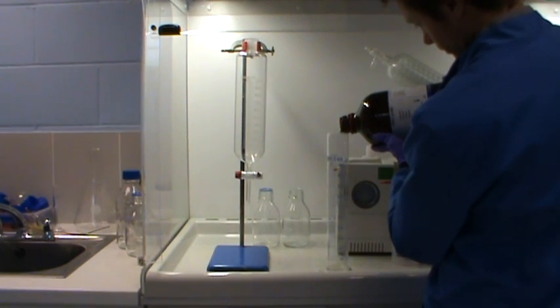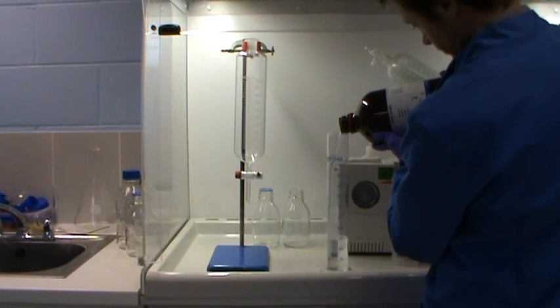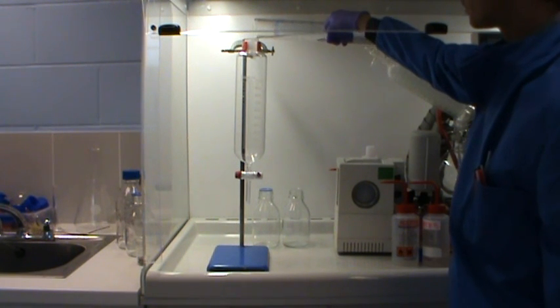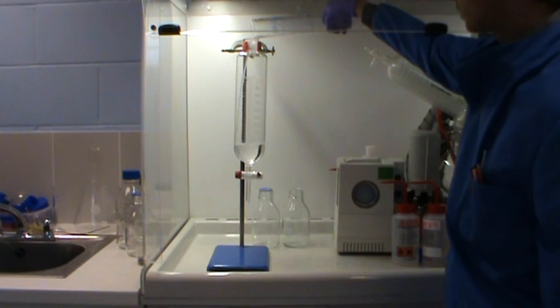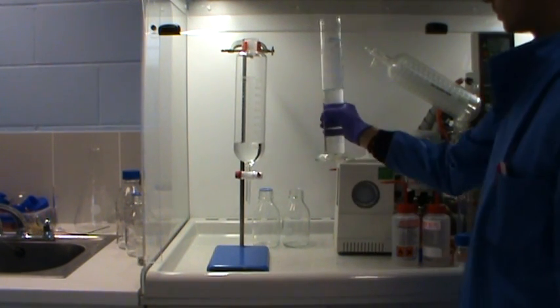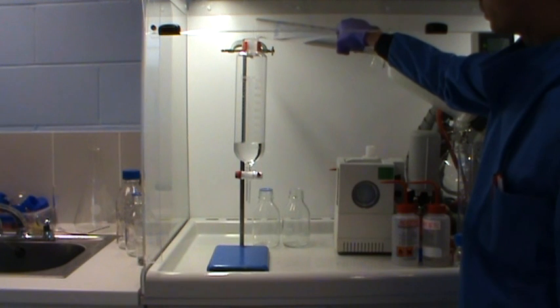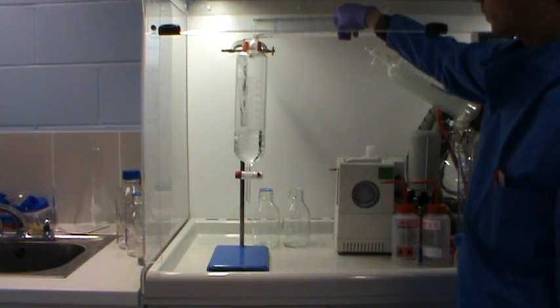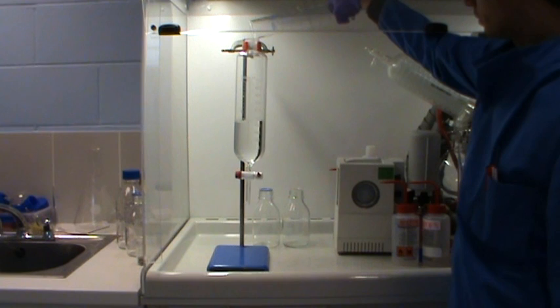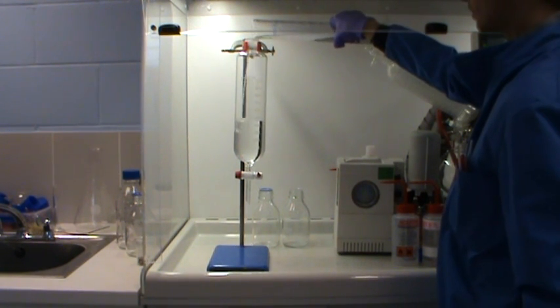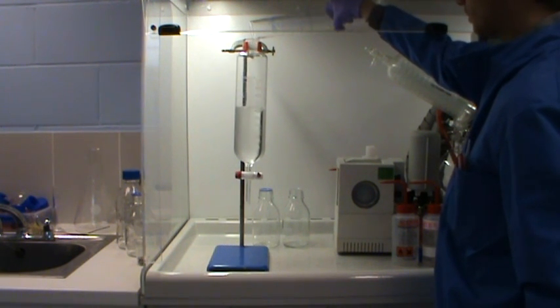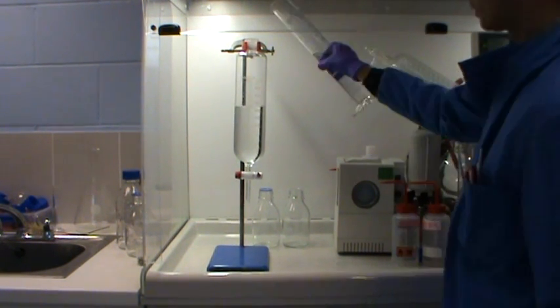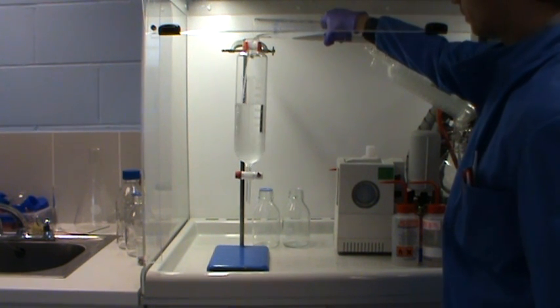Measure each of your solvents in turn. Firstly 200 millilitres of heptane, 300 millilitres of ethyl acetate, 200 millilitres of methanol, and finally 300 millilitres of water.